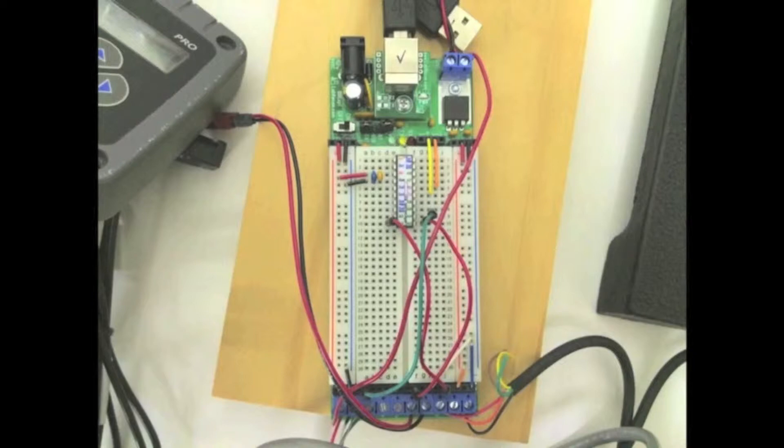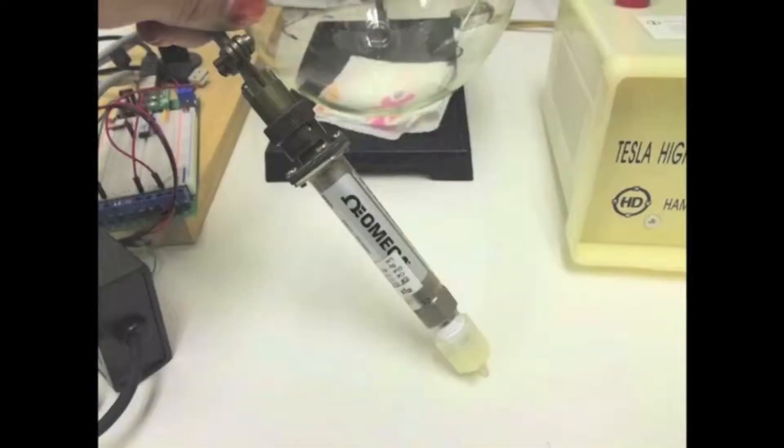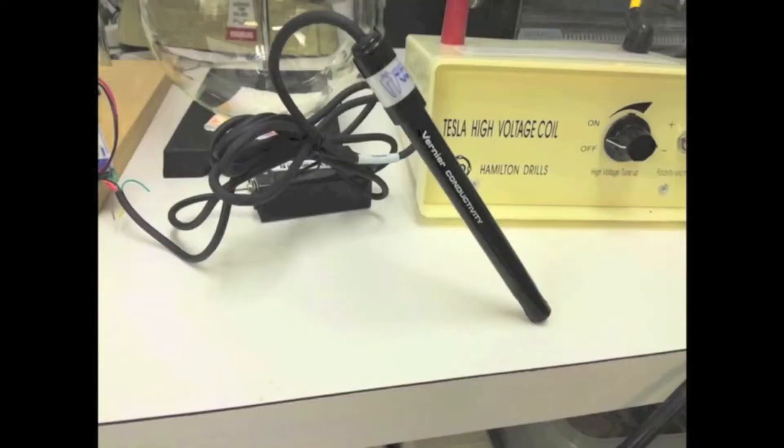Throughout the process, we will be using the LabRecon software, breadboard experimenter, and chip to measure the pH, pressure, temperature, and conductivity of the mixture.